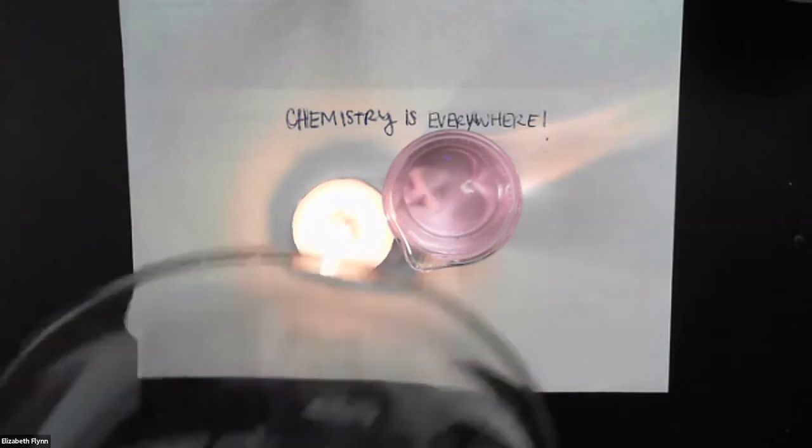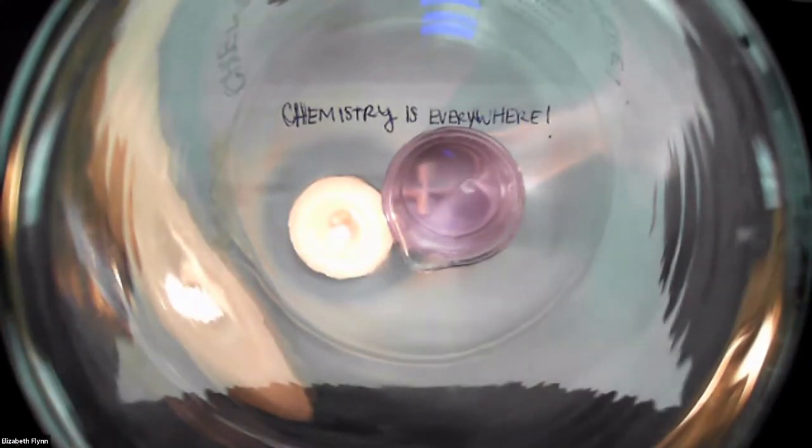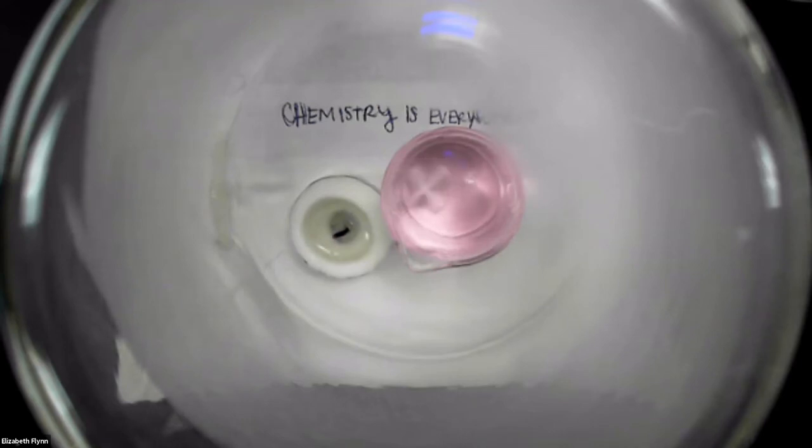So what we're going to do is place this big beaker right on top. It's a 2-liter beaker. And so we're going to close this system. And let's see what happens. What do we start to see happening over here and on the walls? It's getting a little cloudy, right? What is that, do you think? Yeah, that is the condensation, which tells us that water is produced as a product in this reaction. Ooh, and what just happened to the flame? Right, it went out. So that tells us that oxygen was required for the reaction to occur as well, for the chemical change.